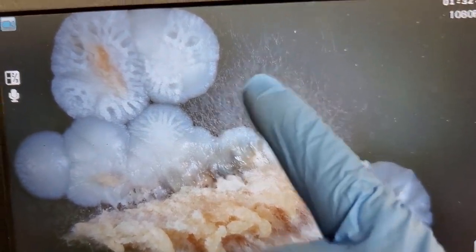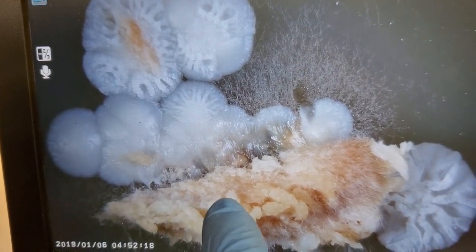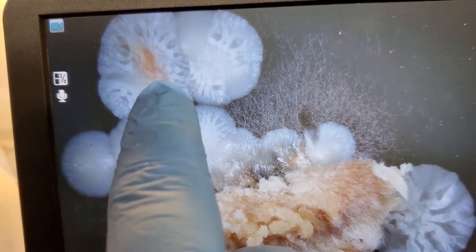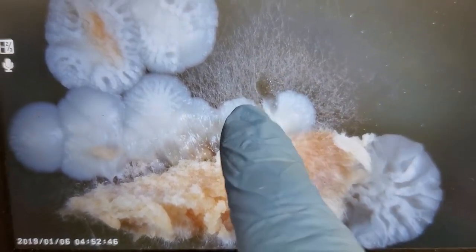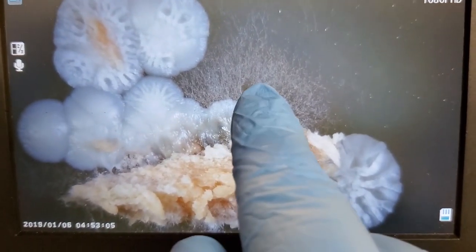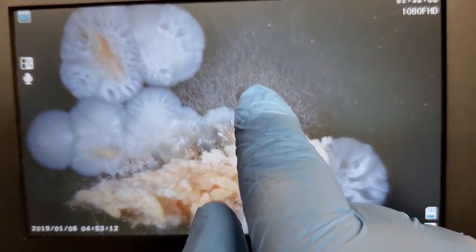So it was starting to colonize, but unfortunately, you can see a chunk, which must have been a little piece of the tissue that broke off. Same with right here. This must have broken off while I was transferring it from the scalpel blade onto the agar itself. And you can see that these pieces are completely taken over by these rather neat looking bacterial colonies. I'm fairly sure they're, what are they called, lobate or something of that matter, irregular bacterial colonies. We're not all that worried about the type of bacteria we're dealing with. All we're worried about is the fact that we are dealing with contamination. What this suggests to us is that, despite the contamination, we did at the very least provide a decent environment for this to grow if it wasn't contaminated, because it is trying to colonize this petri dish.